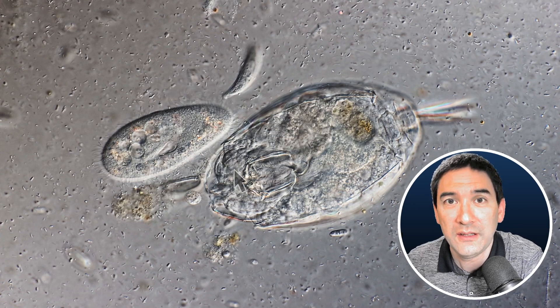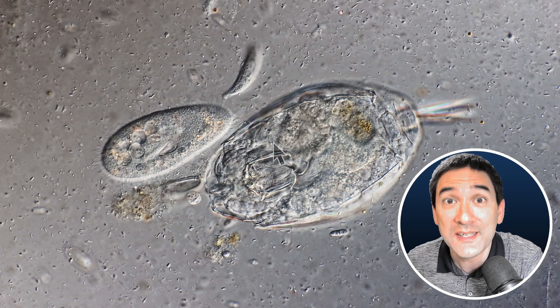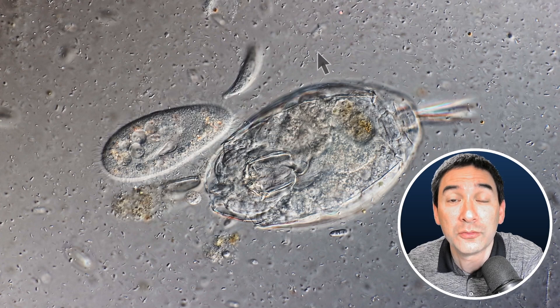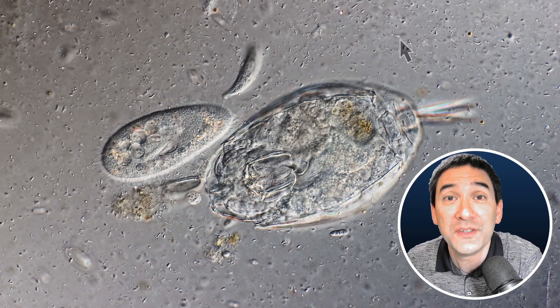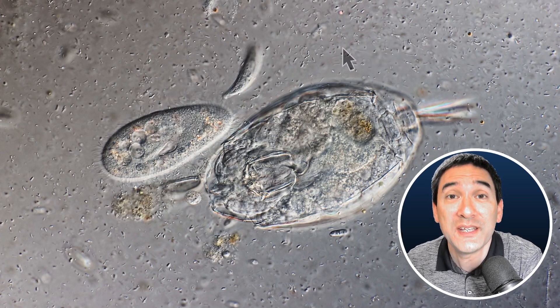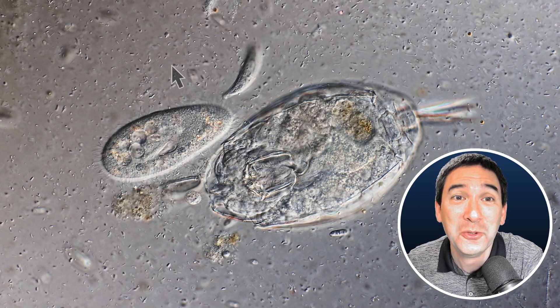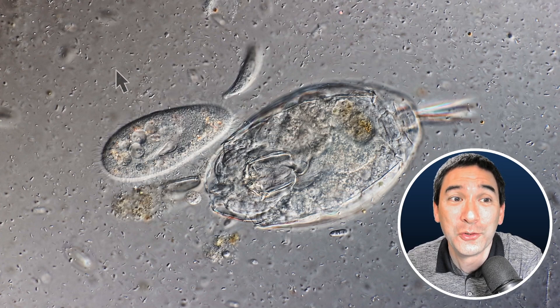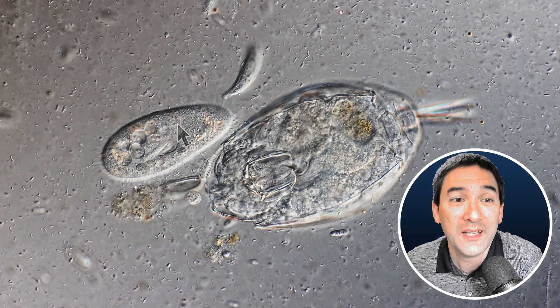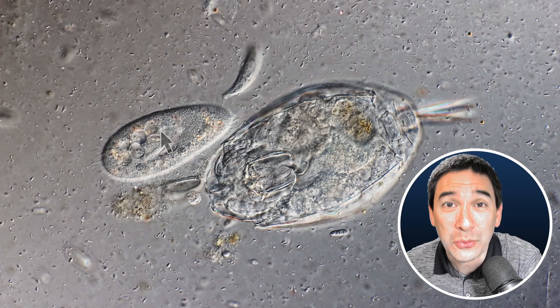So this can already show a little bit something about the possible size difference of the cells. And here in the background, those little dots that you see swimming around, floating around — these are bacteria. Each one of those dots is also a separate cell. So what we already see is that there's a huge difference in cell size between those bacteria, called prokaryotes, and the paramecium over here, which is a eukaryote.